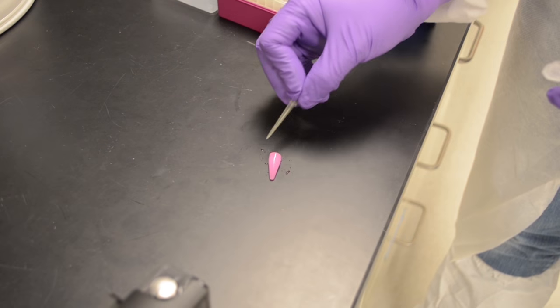So far, all I've shown you guys is one grad student in one field, in one lab, talking about science. But I think it's time that that changes. So today is the first of a new series where I take my camera and I follow around other graduate students and talk to them about what they're doing in their labs. So today, let's go on our very first field trip to visit my collaborator and friend, Sasha.